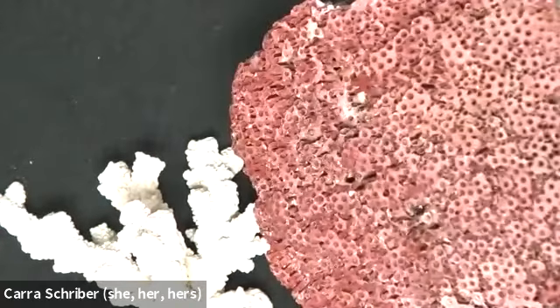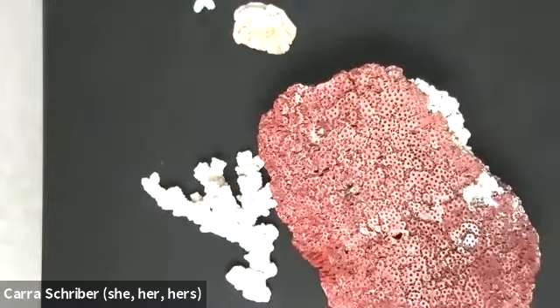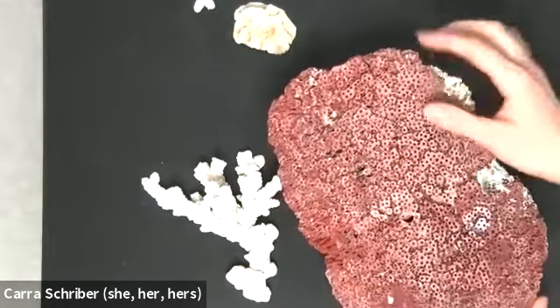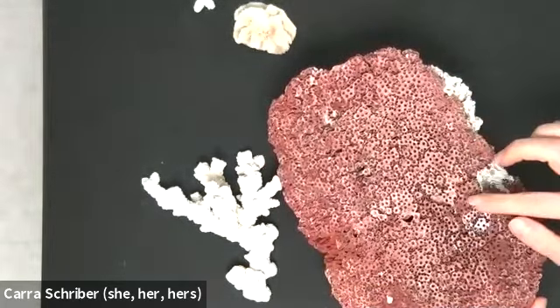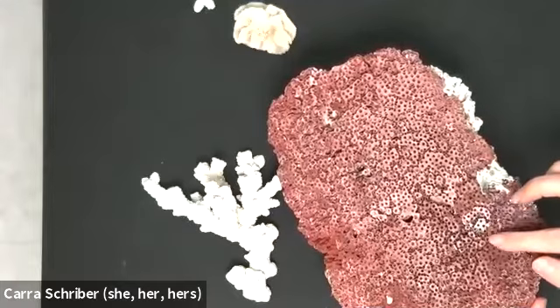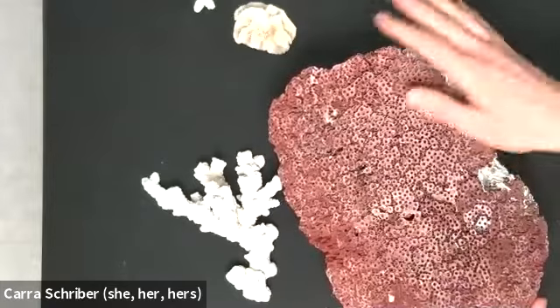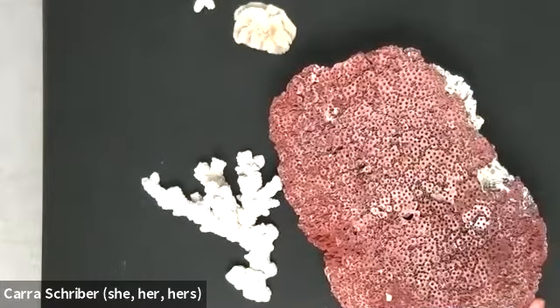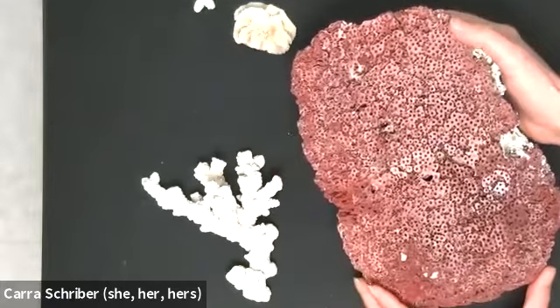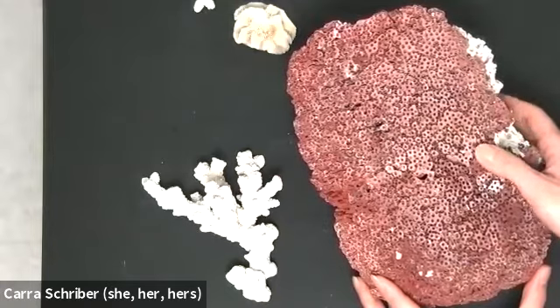This one is big. Okay. But you see all the holes? Like you see how it's speckled? And every single one of these holes would be a little polyp or a little member of this coral community. So in this particular coral, right, there would be hundreds, maybe thousands of little polyps all in here. And then they're creating a little calcium carbonate shell that they live in that protects them from the elements.